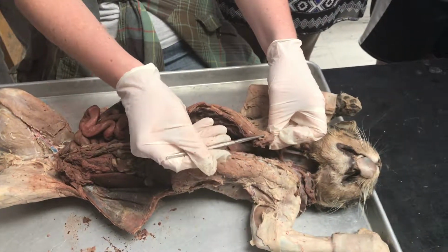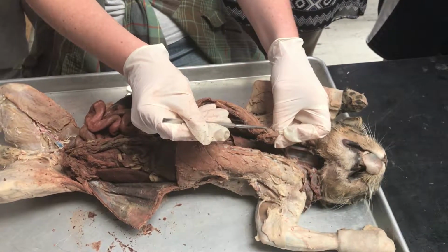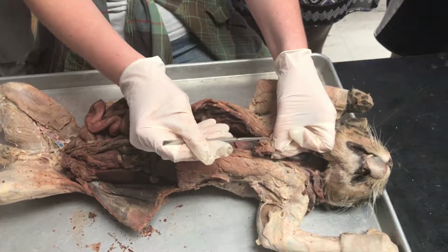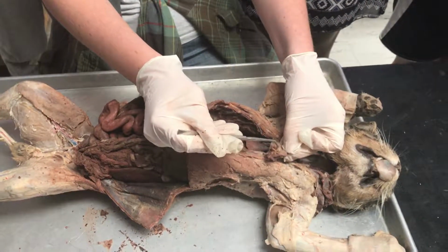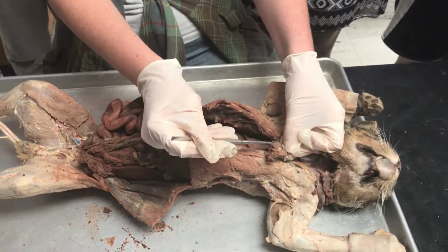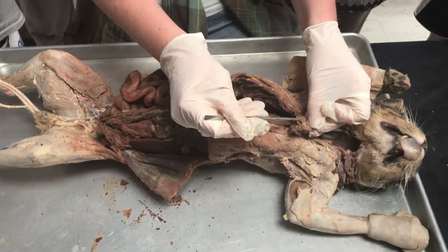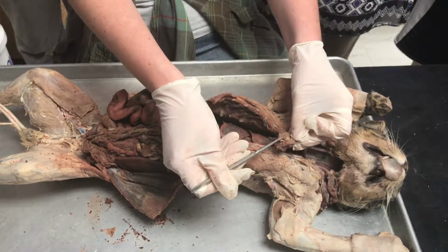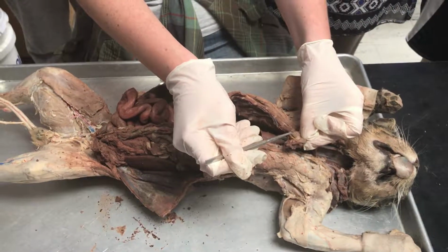Lining the glottis, you have vocal cords. Directly on the side, which are these right here, you have the true vocal cords. And then on the outside, closest to the outside of the trachea, are your false vocal cords. Can y'all see those? So you've got your glottis here, which is the hole, and right on each side of my probe, touching my probe, are the true vocal cords. And then here on the very outside, these are your false vocal cords.